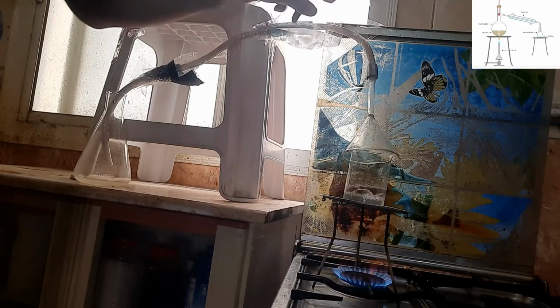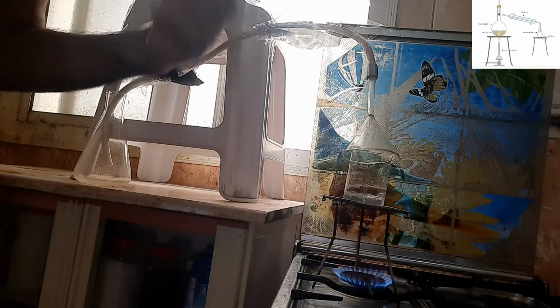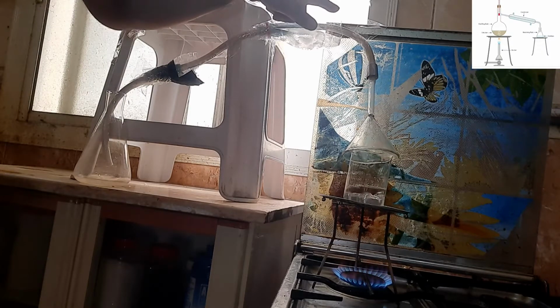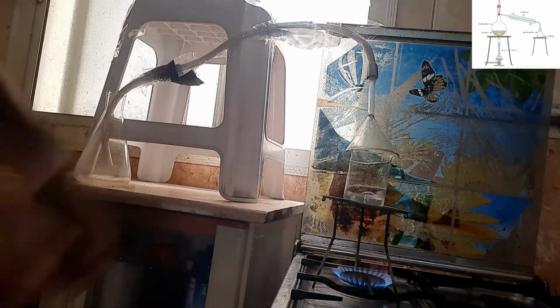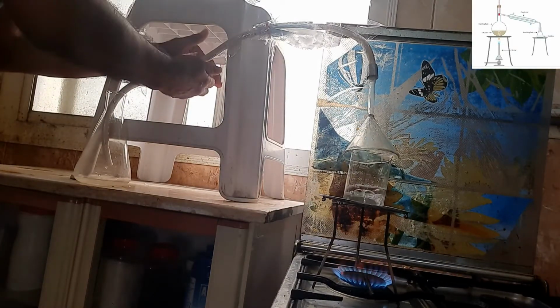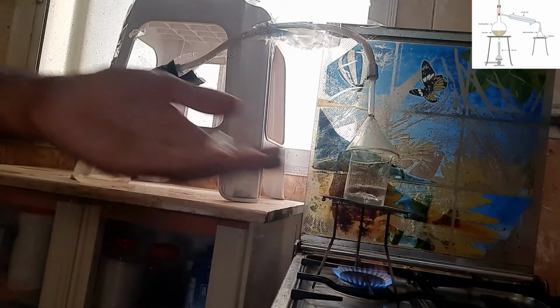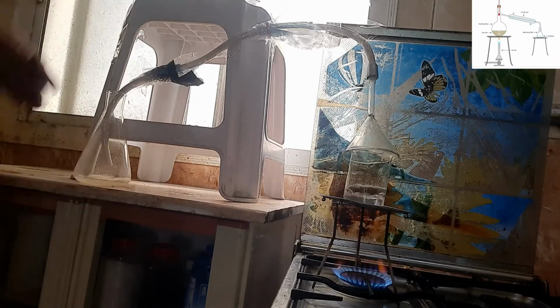So the condenser is responsible for making the vapor cool. When the vapors lose their energy, where does the energy of the vapor go? The energy of the vapor will enter the ice. This ice will get energy from the hot vapor. Therefore the ice is going to melt, and the ice is melting because of the heat of the vapors which are produced from here. And this is another condenser. It also has some ice cubes. I have placed some ice cubes to make it cool. So these ice cubes are responsible for making the condensation procedure fast.